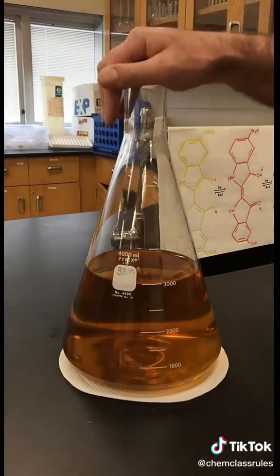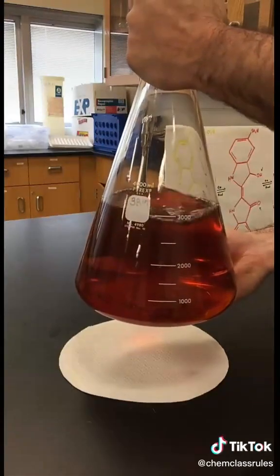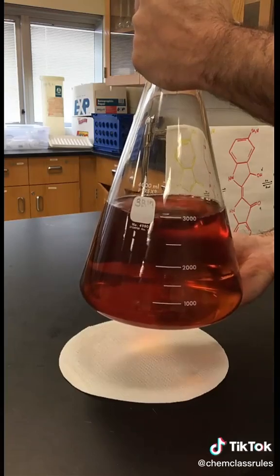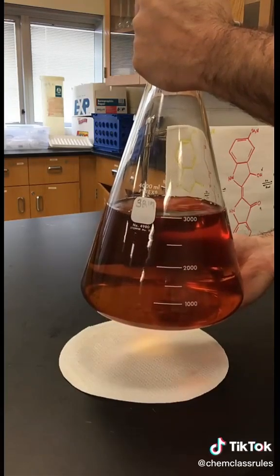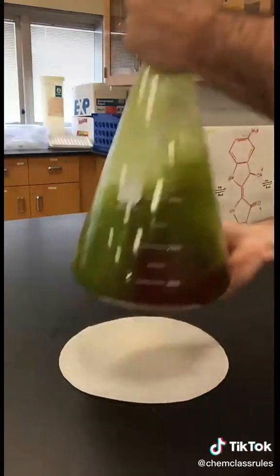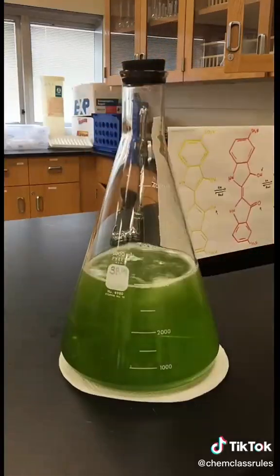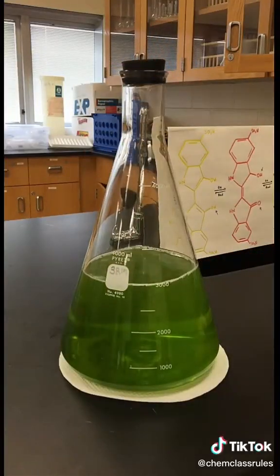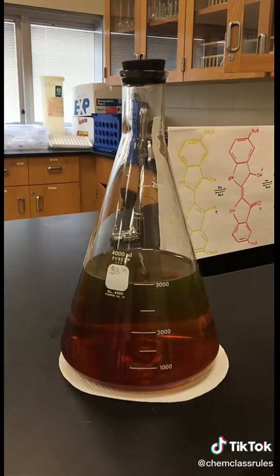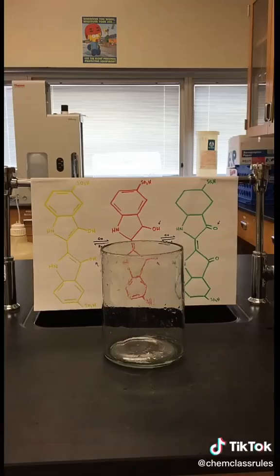There we have our final solution. Starts out yellow. Give it a little shake to incorporate some oxygen, which oxidizes that indigo carmine up to red. The sugar reduces it back to yellow. If we give it a more vigorous shake we go through red and get to green. And as it sits the sugar reduces it from green down to red, and then if we let it sit it will come back to yellow.